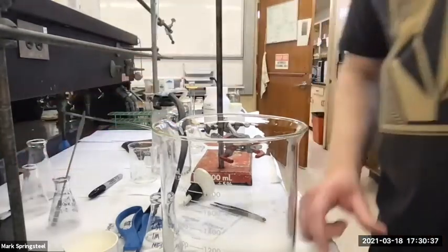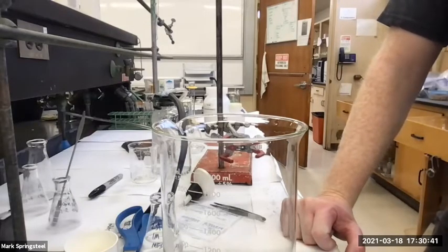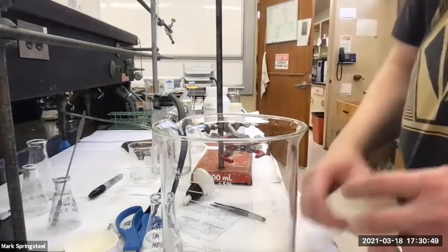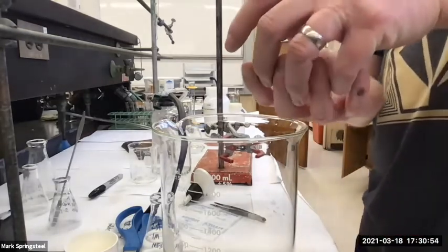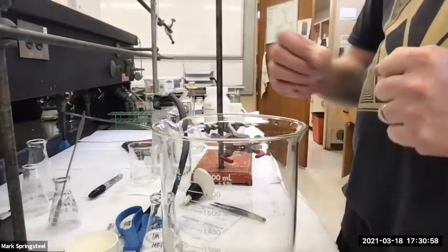Have you heard of the concept of "do what you oughta, add acid to water"? I don't think I've heard that before. What they're saying is add the strong concentrated acid to water to dilute it. Don't add the water to the strong concentrated acid. Gotcha. I do remember hearing something.